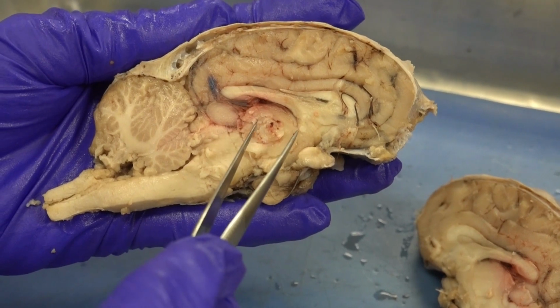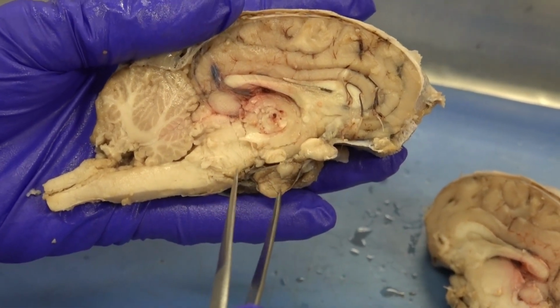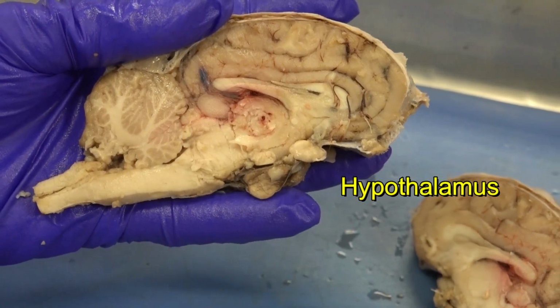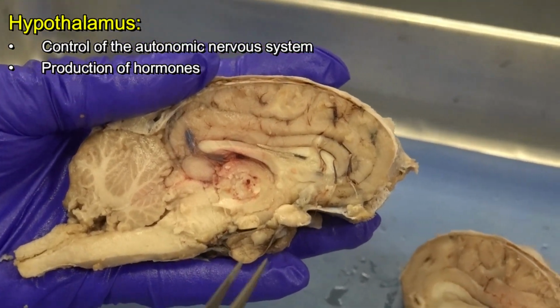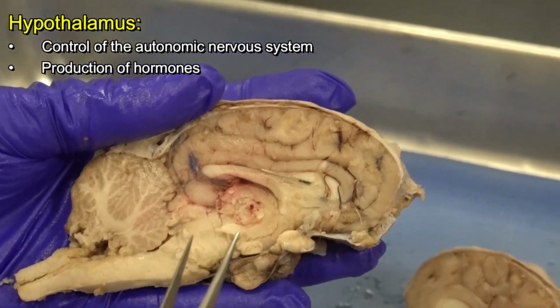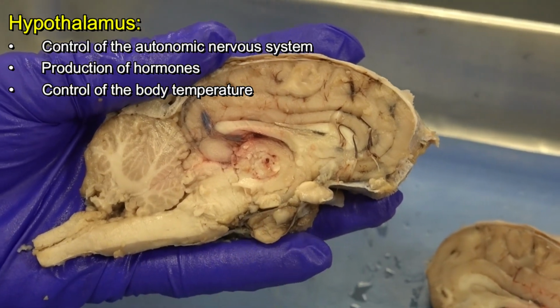Then from the thalamus, when I move anterior and I'm above the pituitary gland, I have the hypothalamus, which has many, many important jobs. The hypothalamus controls the autonomic nervous system. It secretes different hormones. It controls the secretion from the pituitary gland. It's also the thermostat of our body. Basically, it has a significant role in thermoregulation.